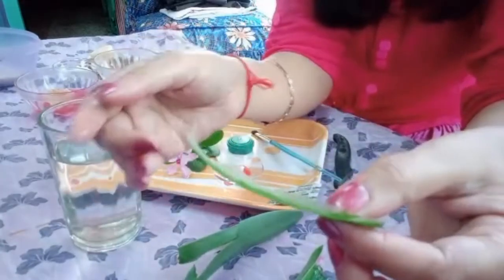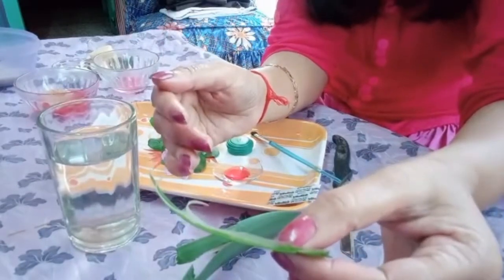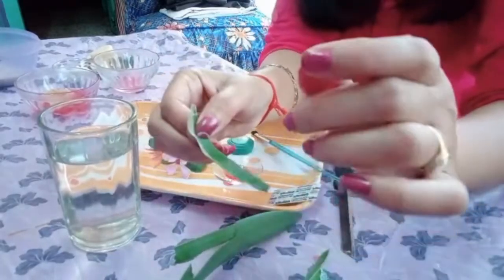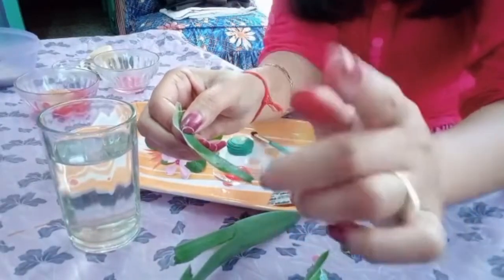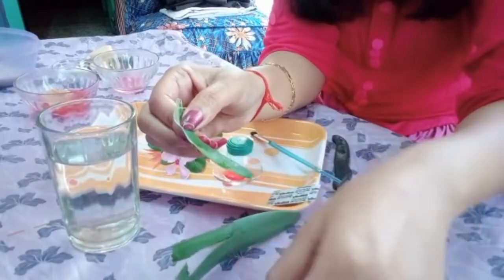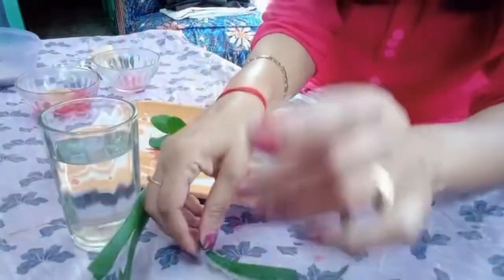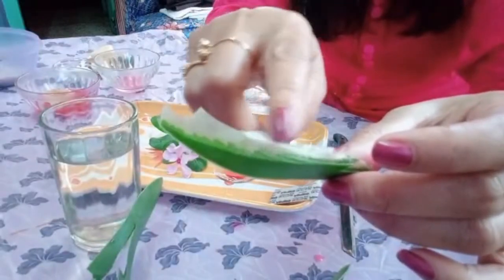You can take the top layer, you can take the bottom layer. For a dicot plant, the undersurface distribution of stomata will be more, and for a monocot it is equal. So if you ask me, is this a monocot or a dicot? Answer is very simple. For a dicot leaf, a reticulate venation is seen, that is, mid vein is there, side veins, and then the veinlets. For a monocot leaf, usually a parallel venation is seen, where you can see the parallel lines. So this is a monocot leaf. You can choose lily. Lily is best. I do not have lily in my garden, so I have chosen this. And you can see the transparent region.